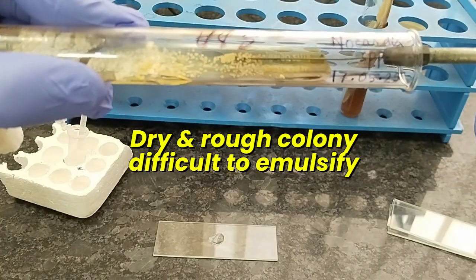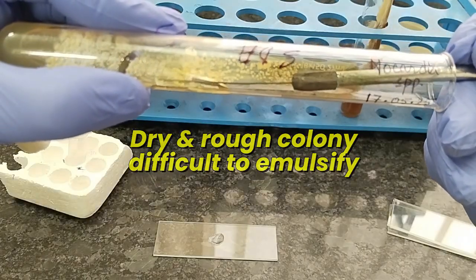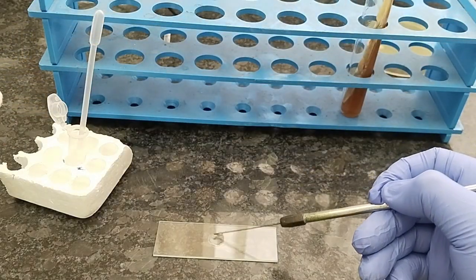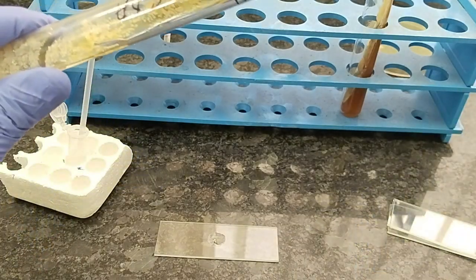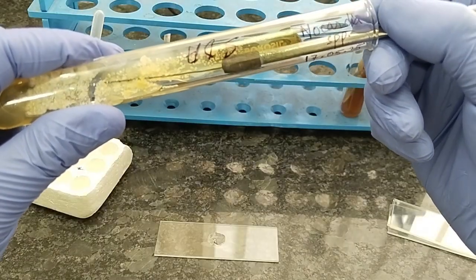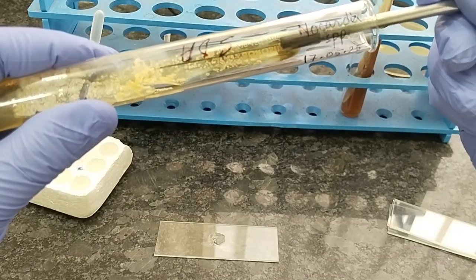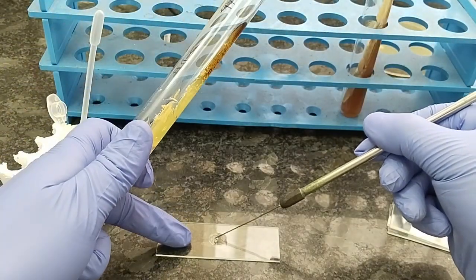I am trying my best to obtain colony from the SD agar, and a little colony will come off. Emulsification is very difficult, so it is very cumbersome and laborious process to make a smear of Nocardia.